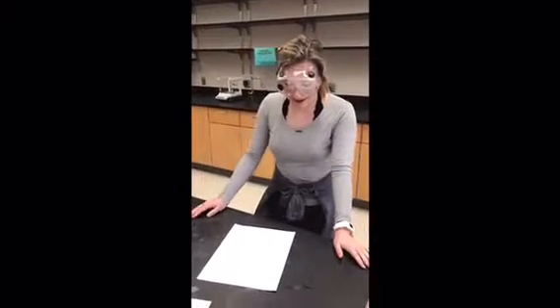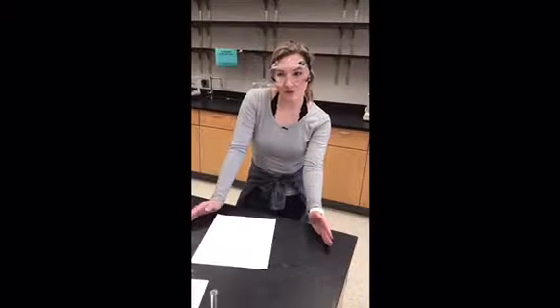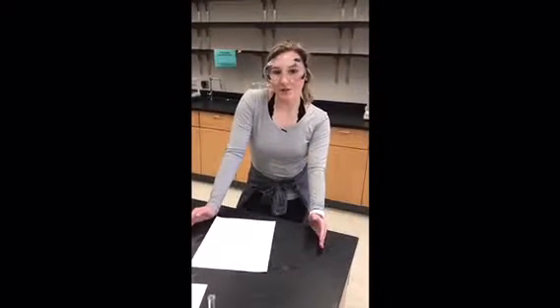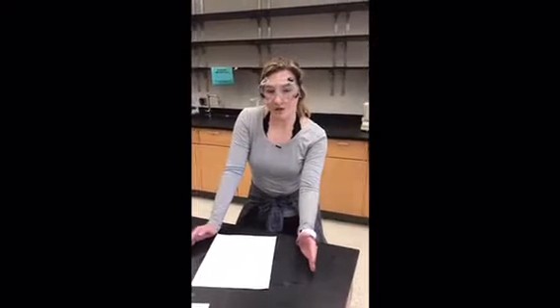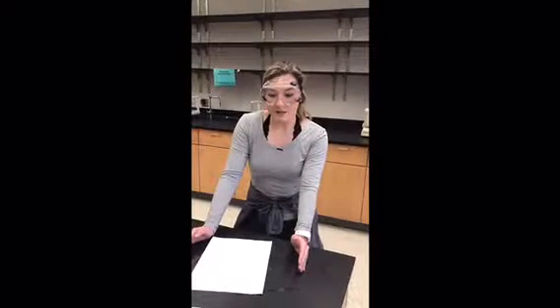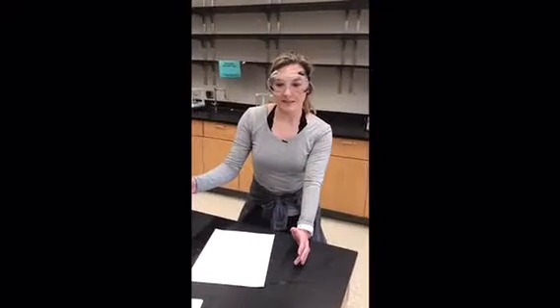So in exercise 2, we are working on understanding the relationship between density and concentration. And in order to understand concentration, we have to contrast stock solution versus dilution. The stock solution that we're given is a solution with a known concentration that we can work with. And when we dilute that concentration, basically what we're doing is we take that concentration and we add a certain amount of water to dilute or make that solution less intensified or concentrated, which is then our dilution.